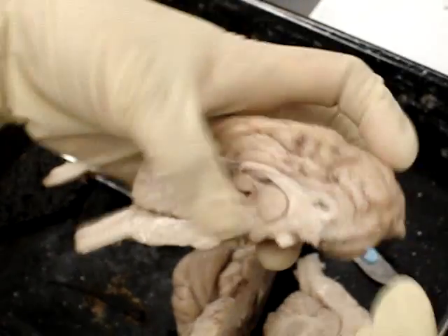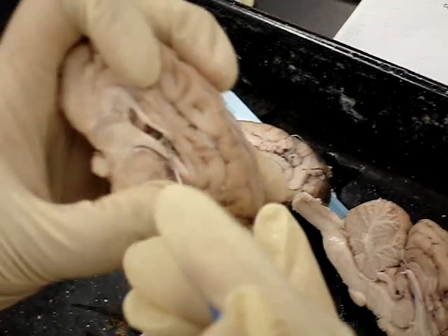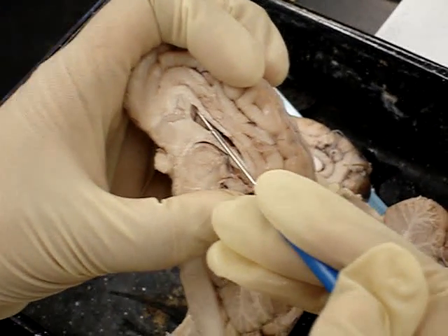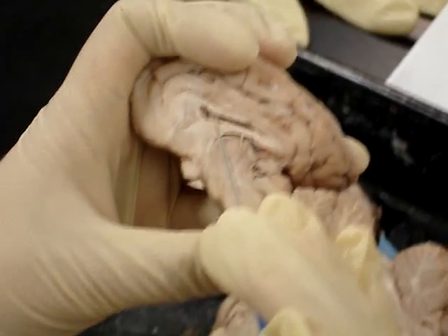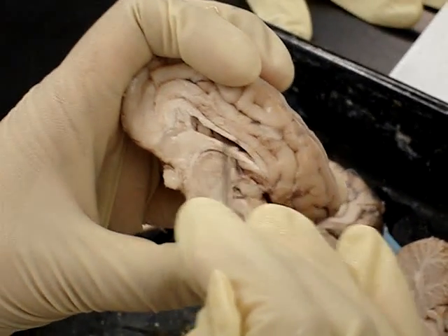The ventricles — the lateral ventricles — there's one on the left and one on the right, and here's one of them. This space right here. There's one on the left, one on the right. It's a space that is the ventricle. You can think of the ventricle as like a holding tank.